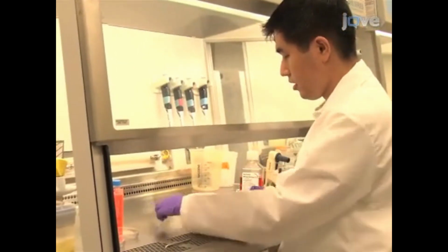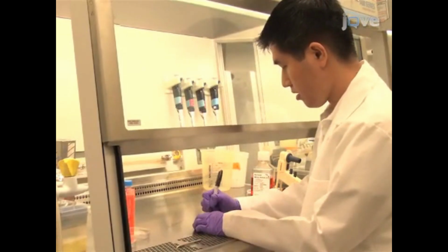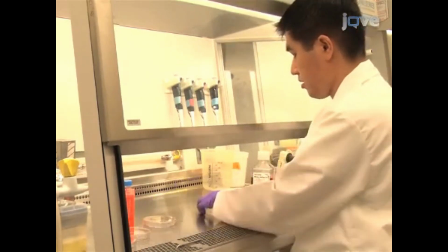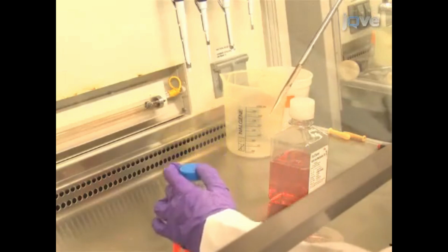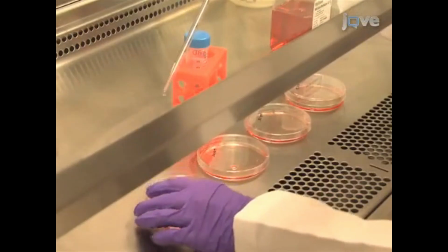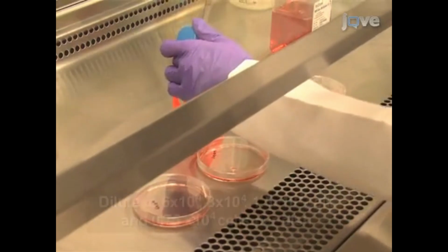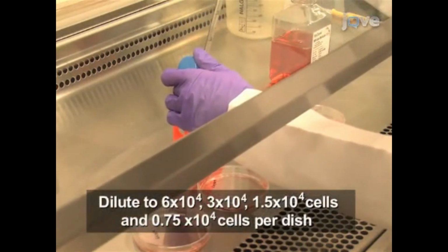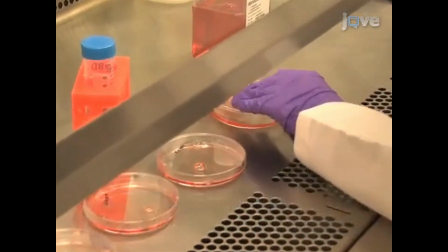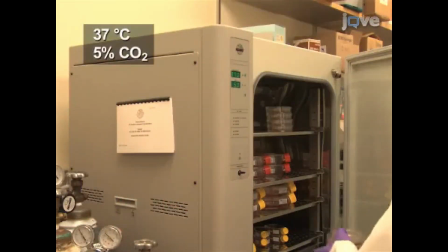Following isolation by flow cytometry and generation of single-cell clones, a colony-forming assay is performed to characterize the MSC cells and the differentiation capabilities. Begin with cells diluted to 3 × 10⁴ cells per milliliter in complete mesenchymal medium. In 100mm dishes, perform serial dilutions to 6 × 10⁴, 3 × 10⁴, 1.5 × 10⁴, and 0.75 × 10⁴ cells per dish in 10 milliliters of media in triplicate. Then place the plates in the incubator.